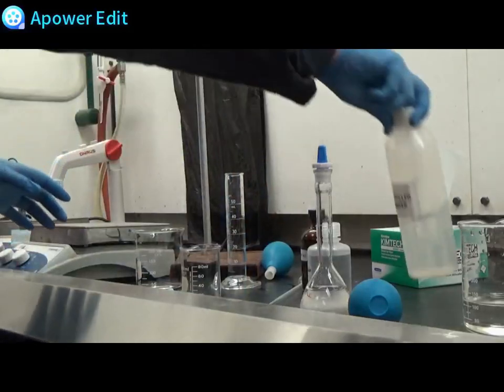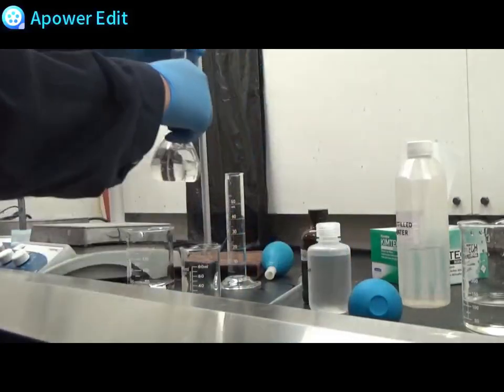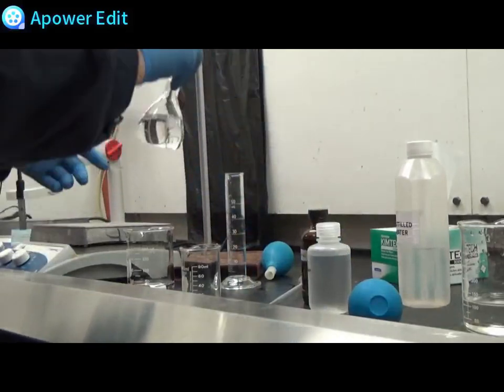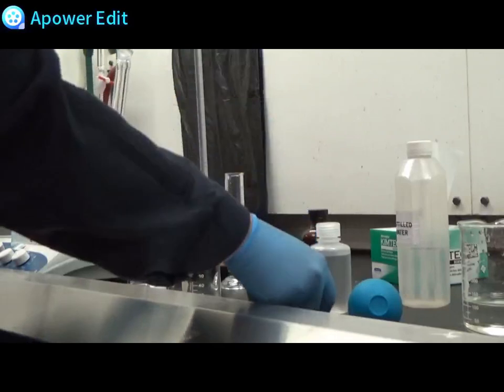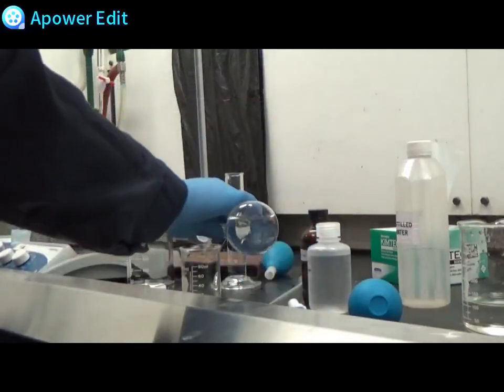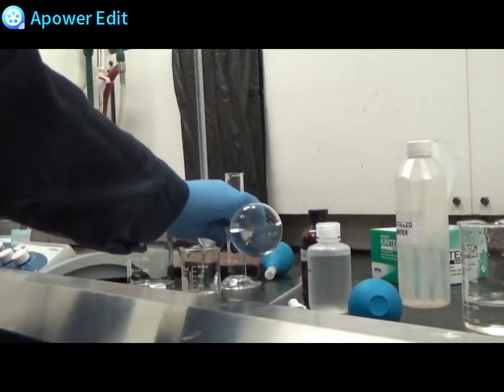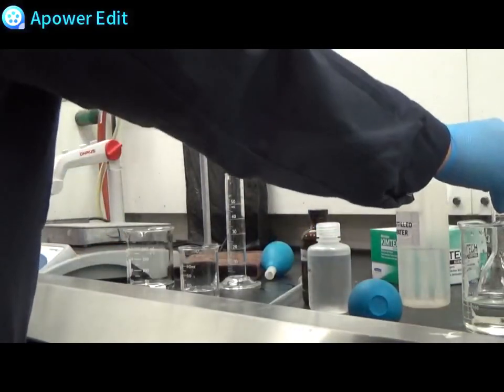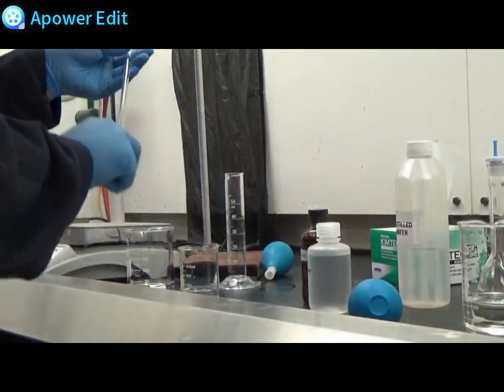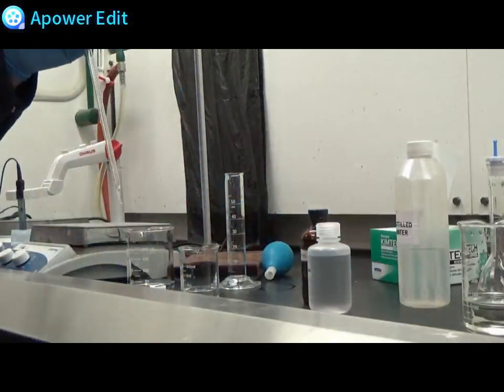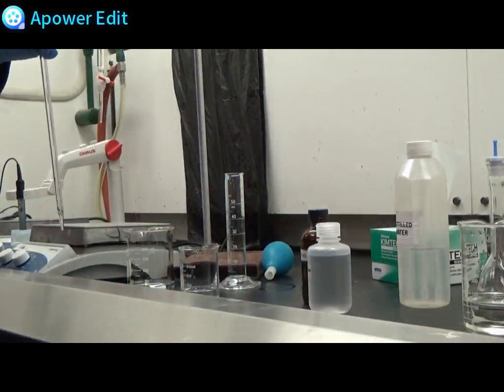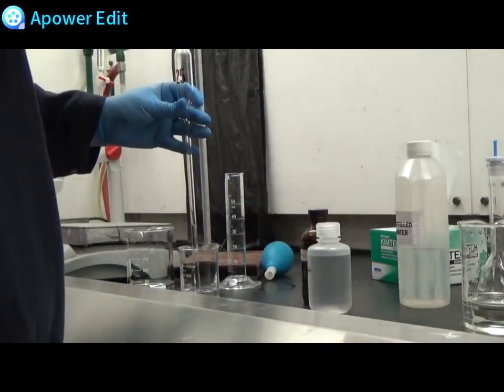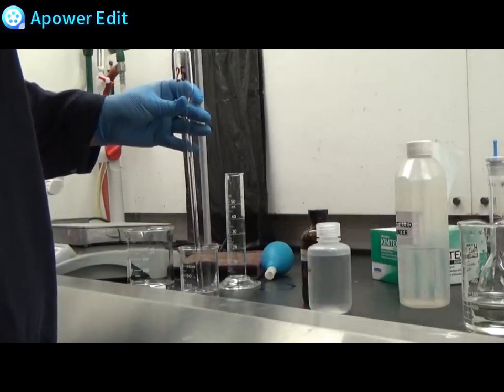Then I will pour out some of the glycine mixture into another beaker to avoid contaminating the stock solution. When you receive the glycine solution you should separate the solution out to prevent the contamination of your main sample.